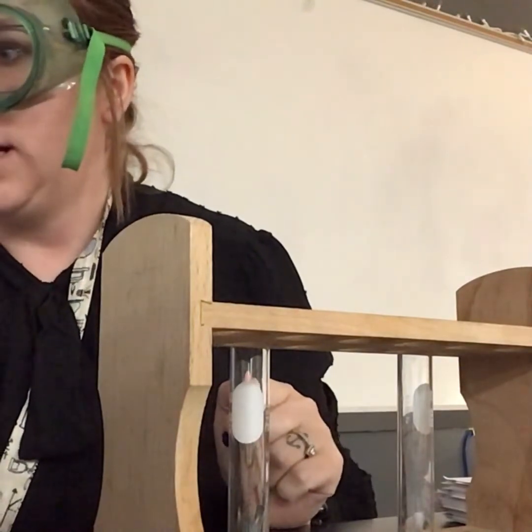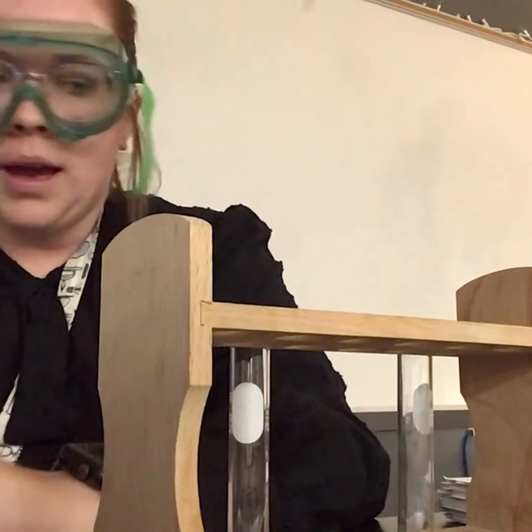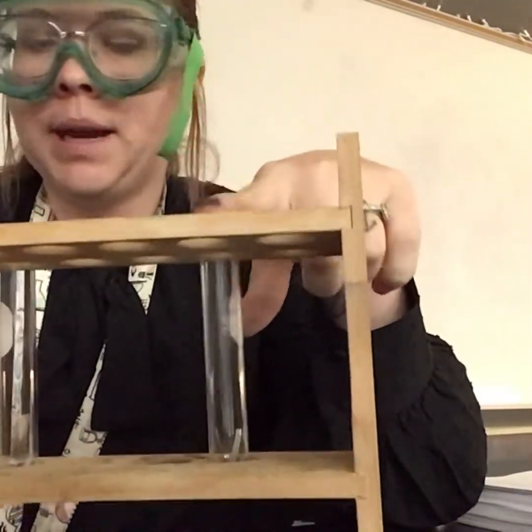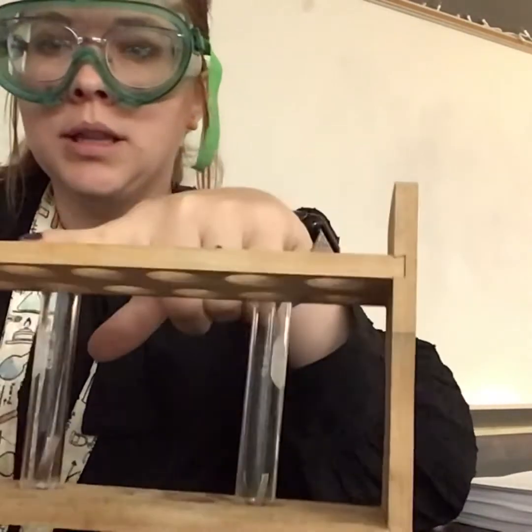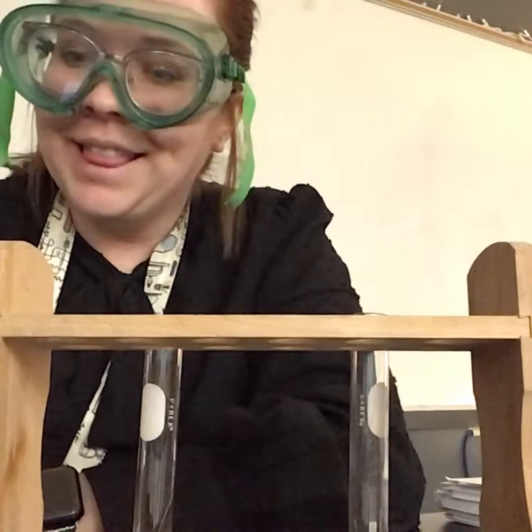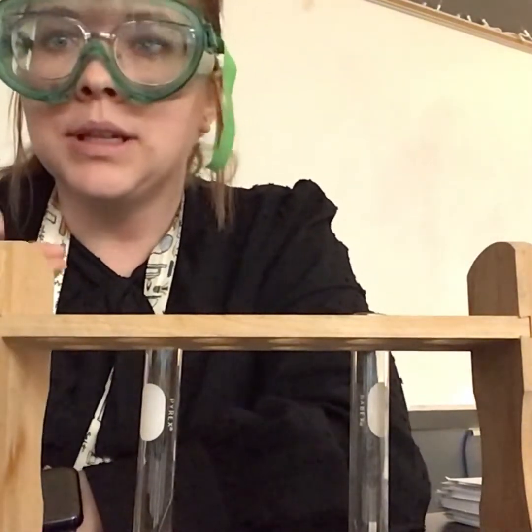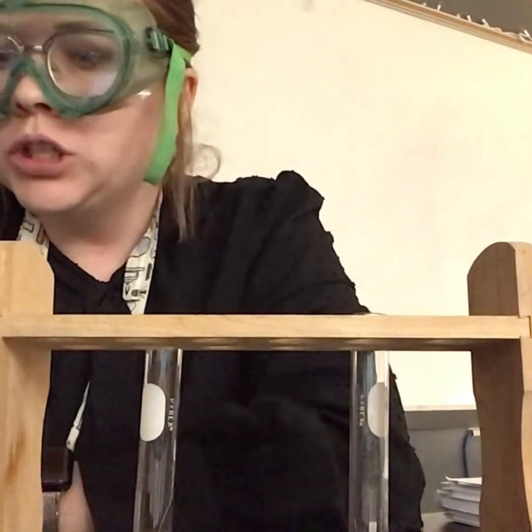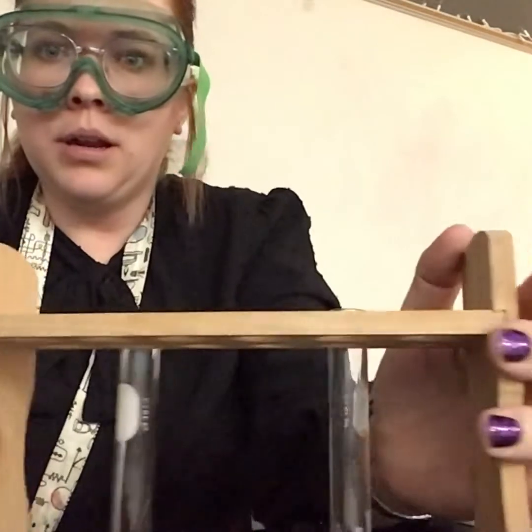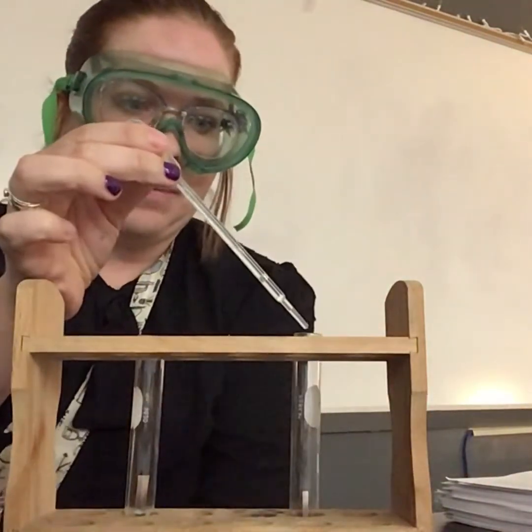So if you're in class we're going to talk about this reaction in class and I'll do this little demonstration for y'all in person. I have put a little piece of magnesium metal in this test tube, this one has a piece of silver, and I have a small beaker of this copper chloride mixed with a tiny bit of water. I'm going to use my dropper and put it in the test tube with the magnesium.